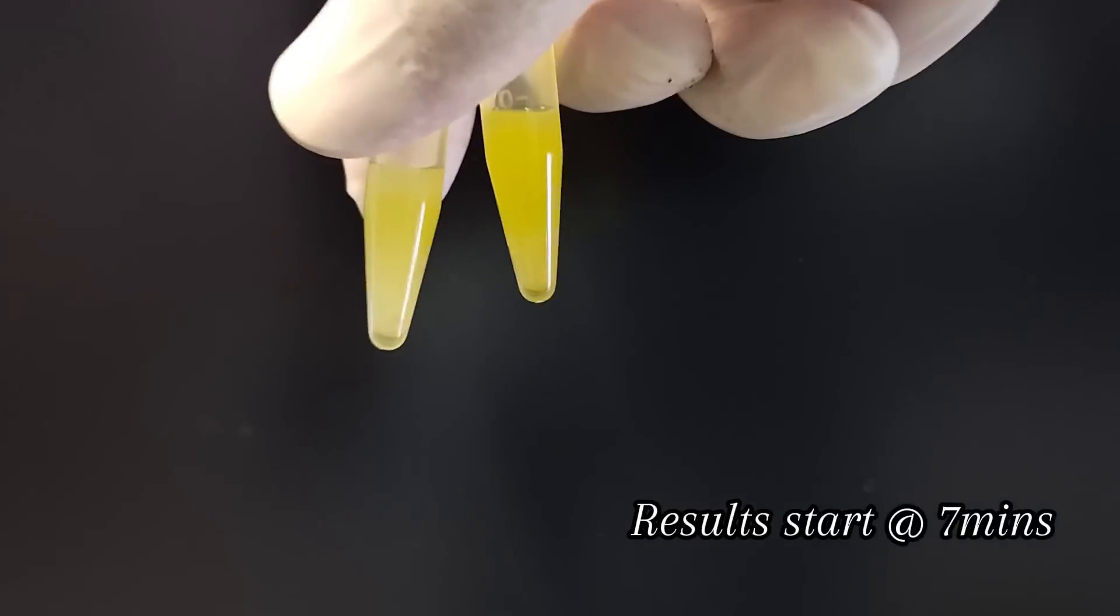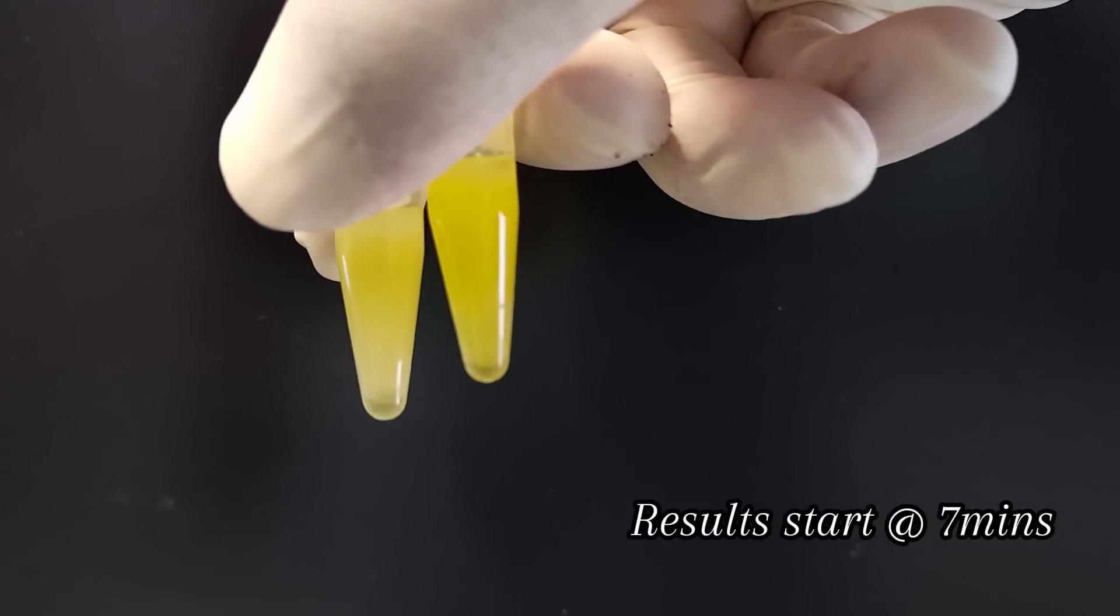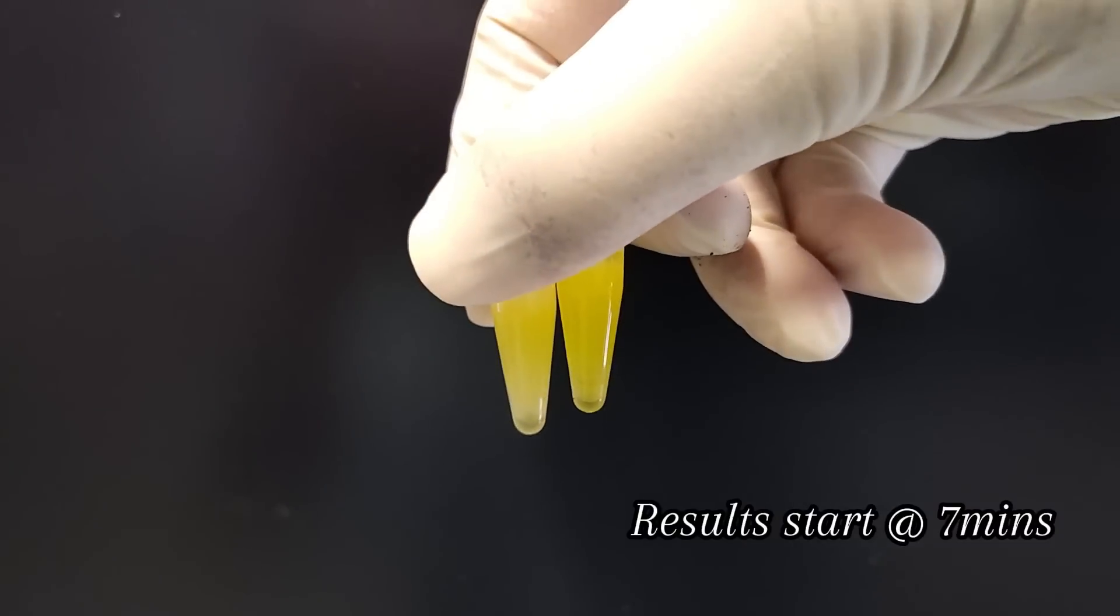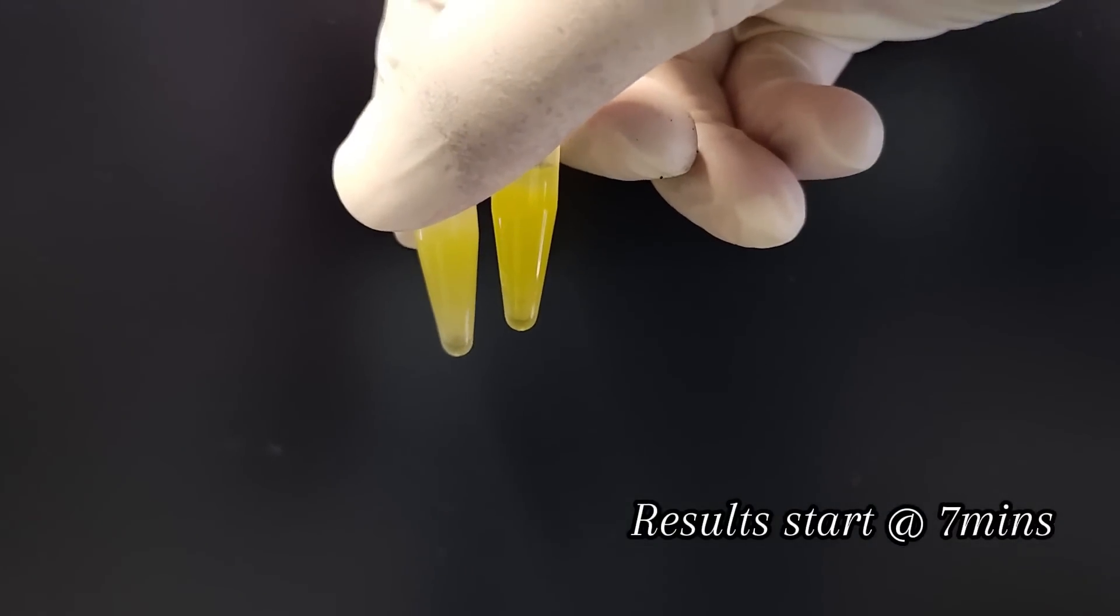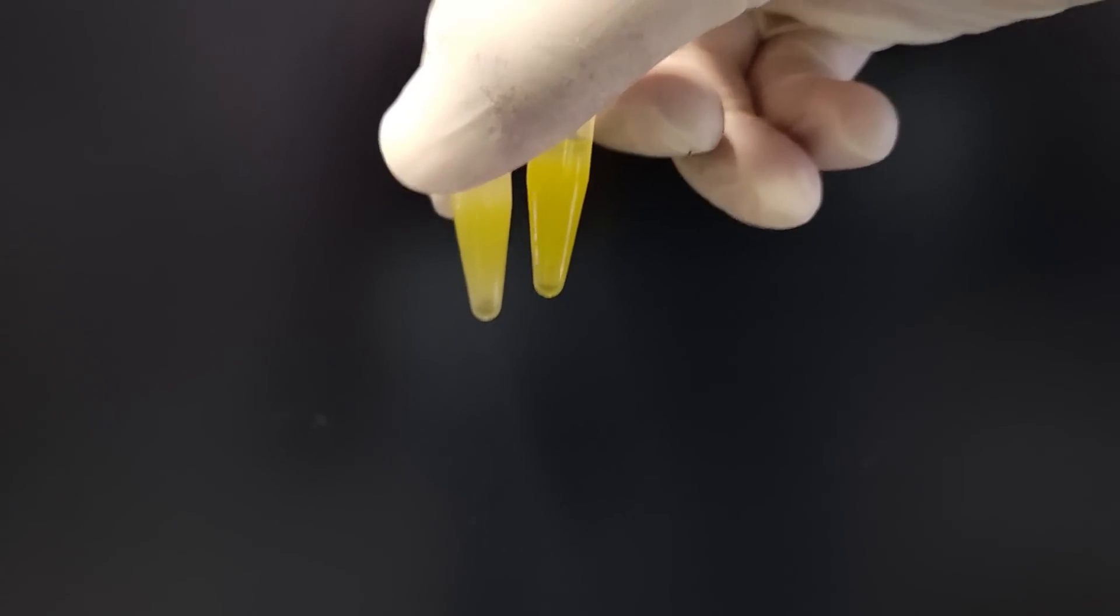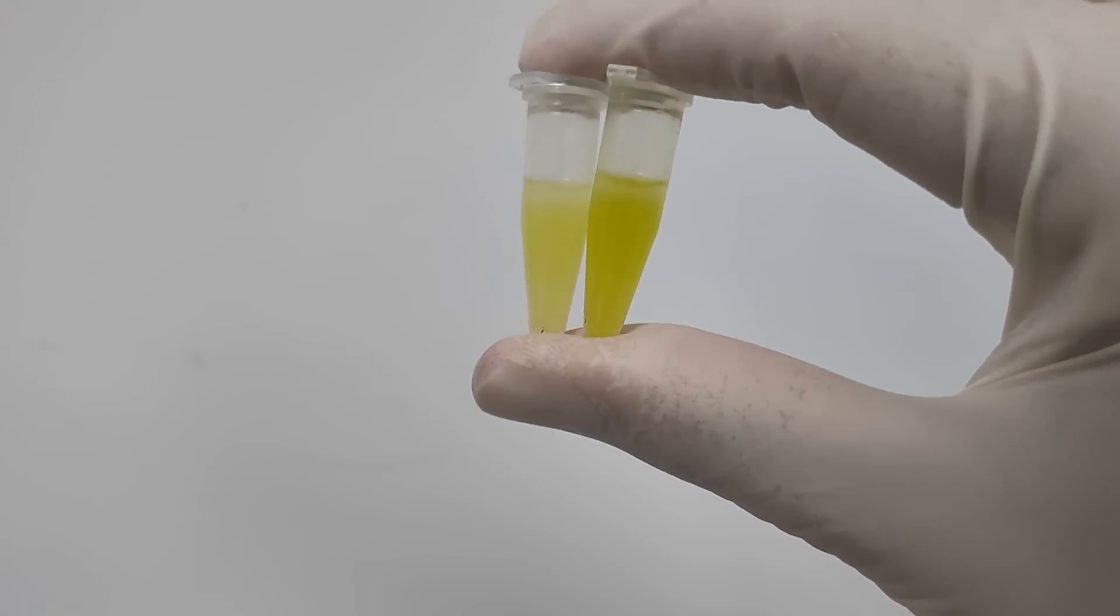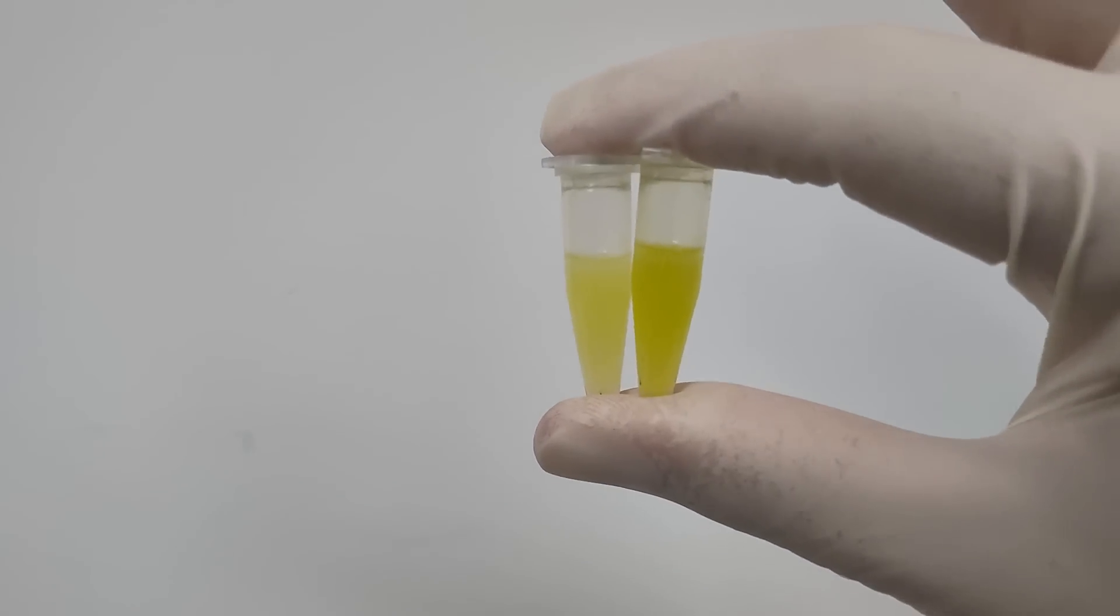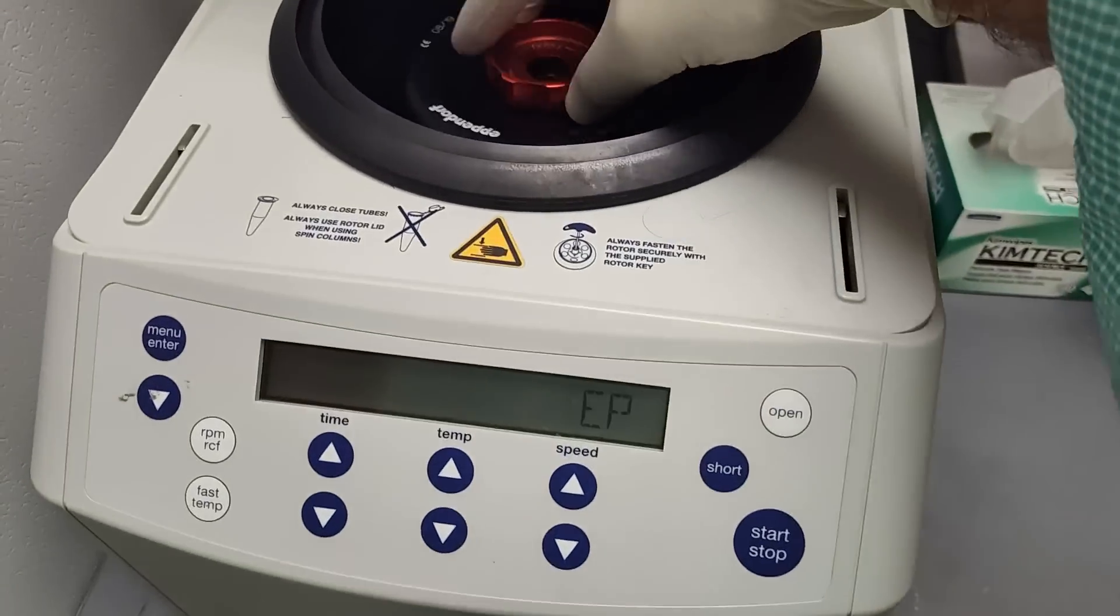So now if we look at them again, side by side, I mean, the one on the right looks more yellow. There's none of this kind of white emulsion separating at the bottom. That's the California olive oil, not the Kirkland. Very interesting. We'll spin these out. And after vortexing even more, you can see the California olive oil on the right has a different color. It didn't look like a different color to begin with, but it is definitely more yellow.